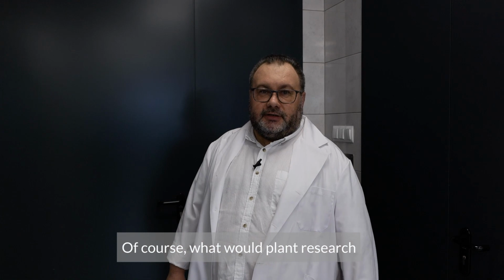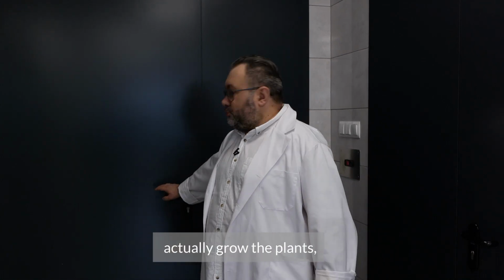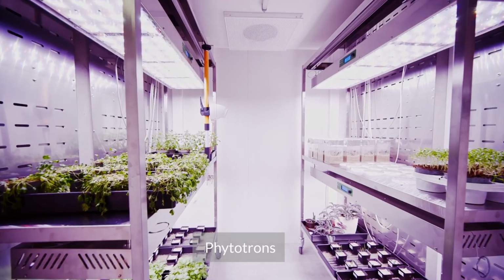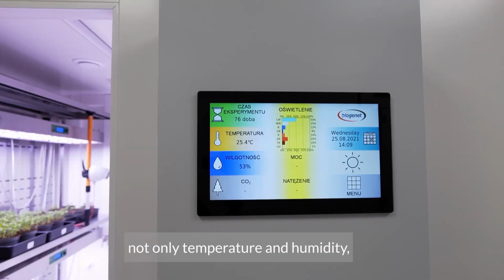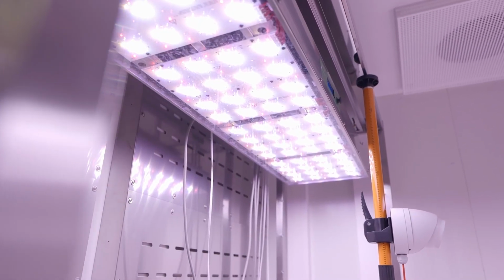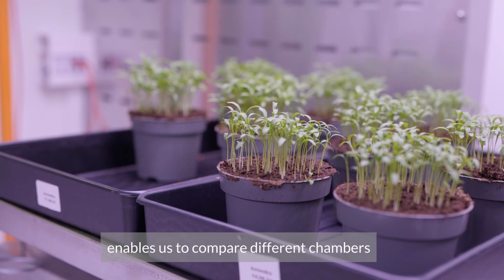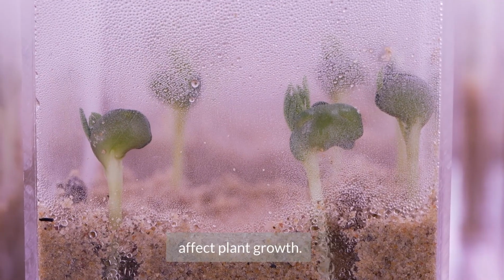Of course, what would plant research be without the possibility to actually grow the plants even in artificial conditions? We use special rooms for growing plants, phytotrons, phytotron chambers, where we can completely control the conditions, not only temperature and humidity, but most importantly, the lighting. The choice of lighting gives us a variety of growing conditions, but also enables us to compare different chambers and see how light and other factors affect plant growth.